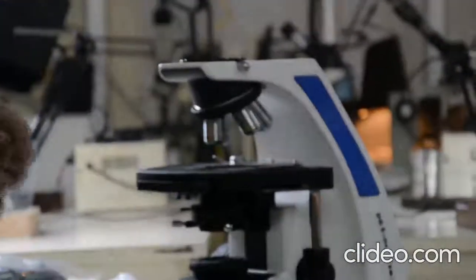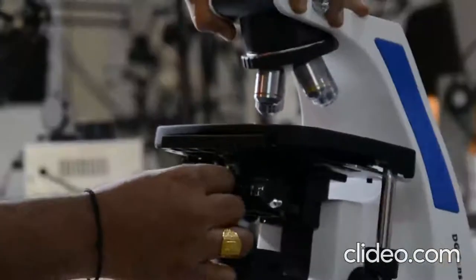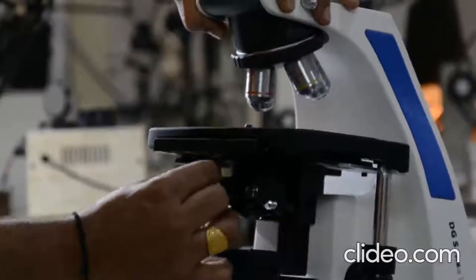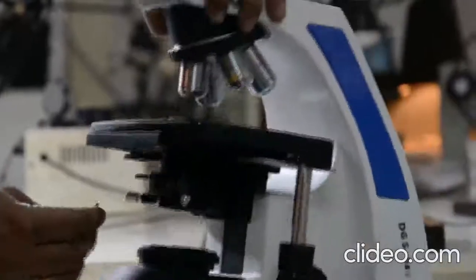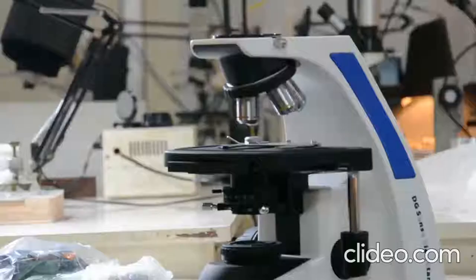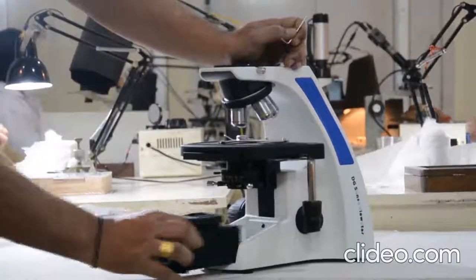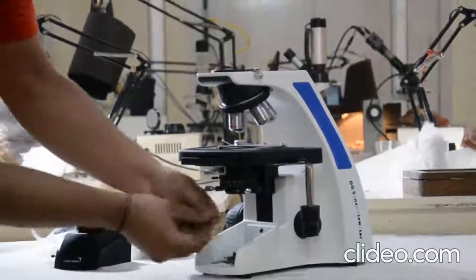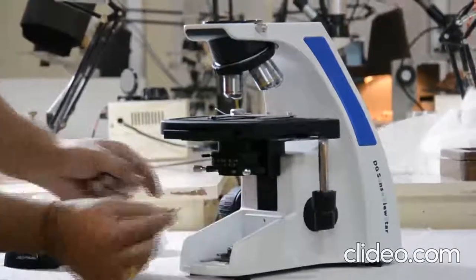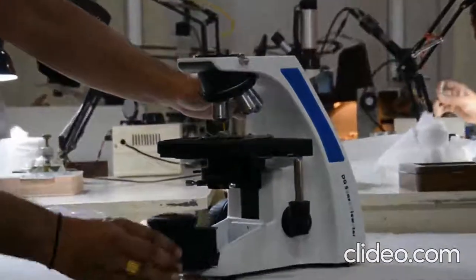Now we will unscrew the locks which are there on the stage. This is a very critical and important part. We always provide this. There is another critical part. You have to take out the section. You have to slide out the illumination. Unscrew the screw from the Allen key and you slide back the illumination.